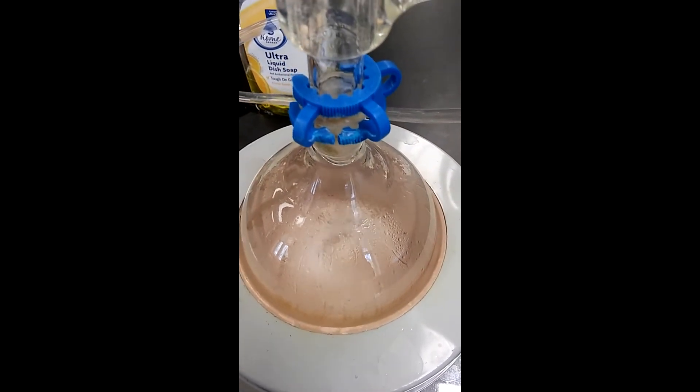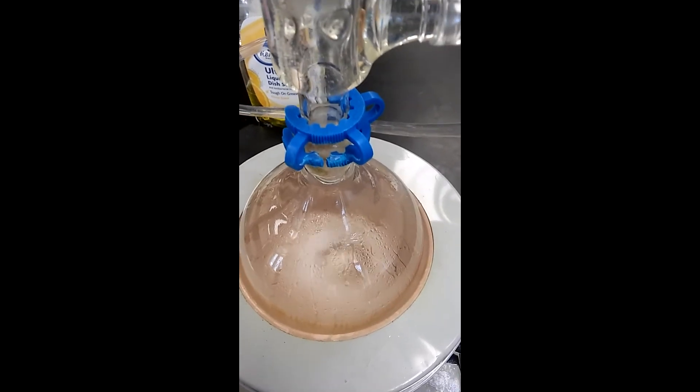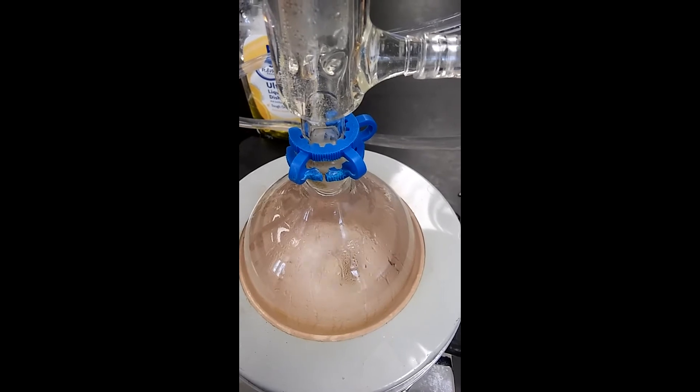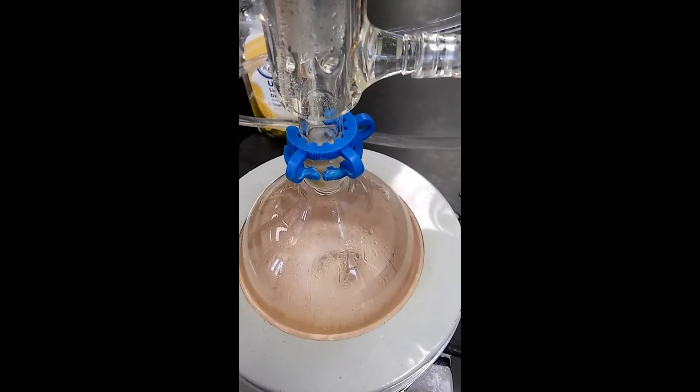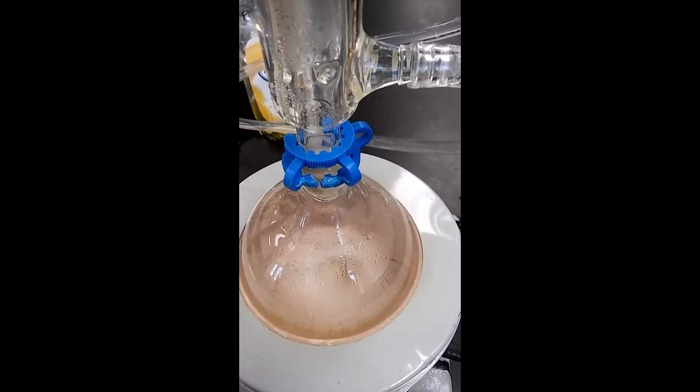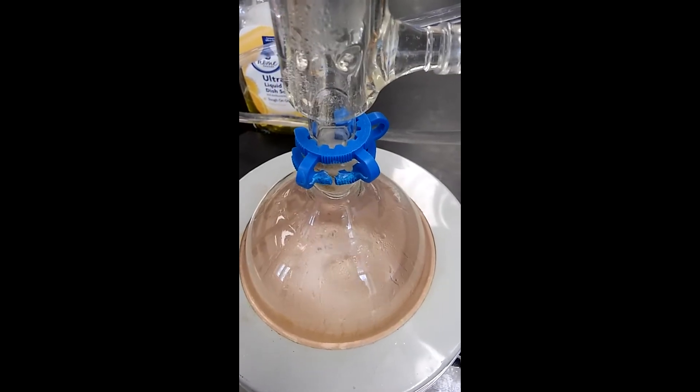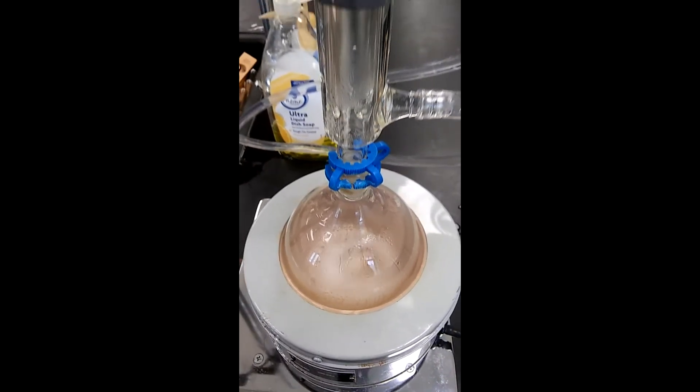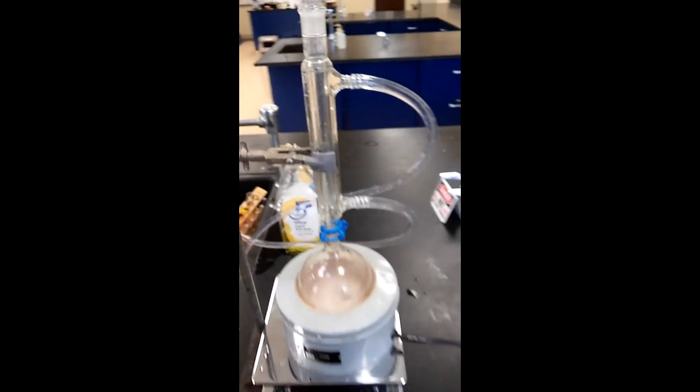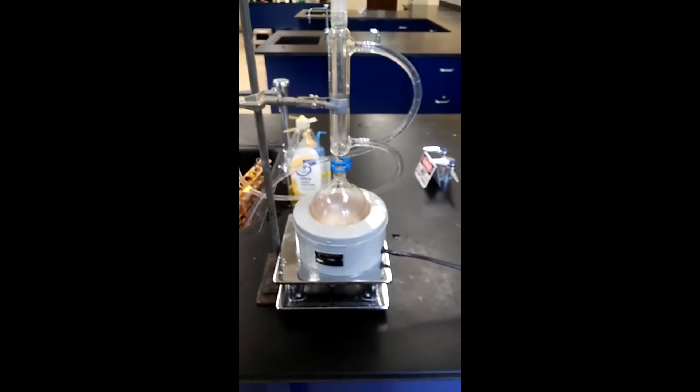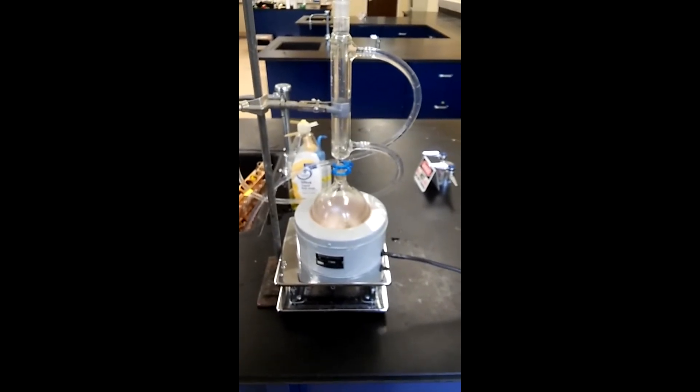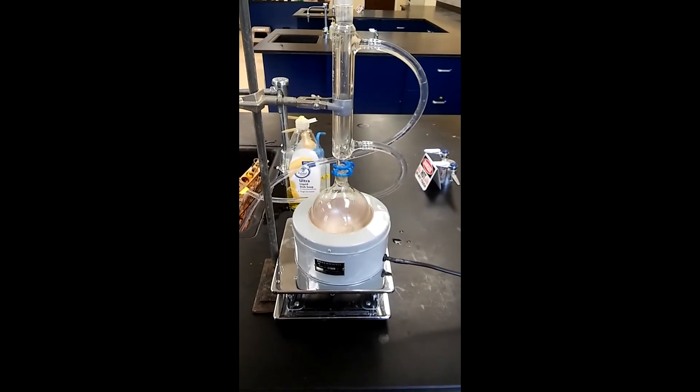Let me zoom in on how the mixture looks. Because I've got a boiling chip, the boiling is pretty even. You can count the number of drops dripping. It should be about a drop a second, maybe a little faster, but a drop a second I think would be the average number. That's probably good refluxing. The whole setup looks good. I'm going to turn off here and come back with the extraction procedure when the reflux is done.